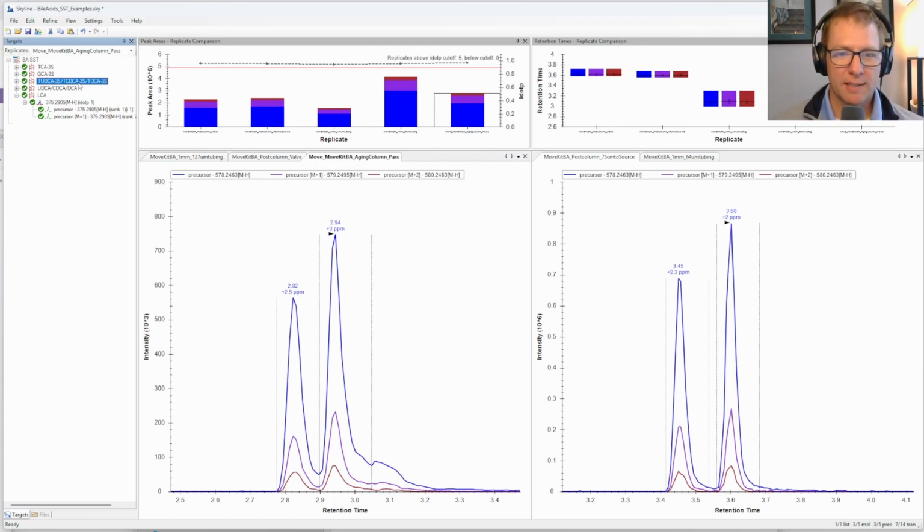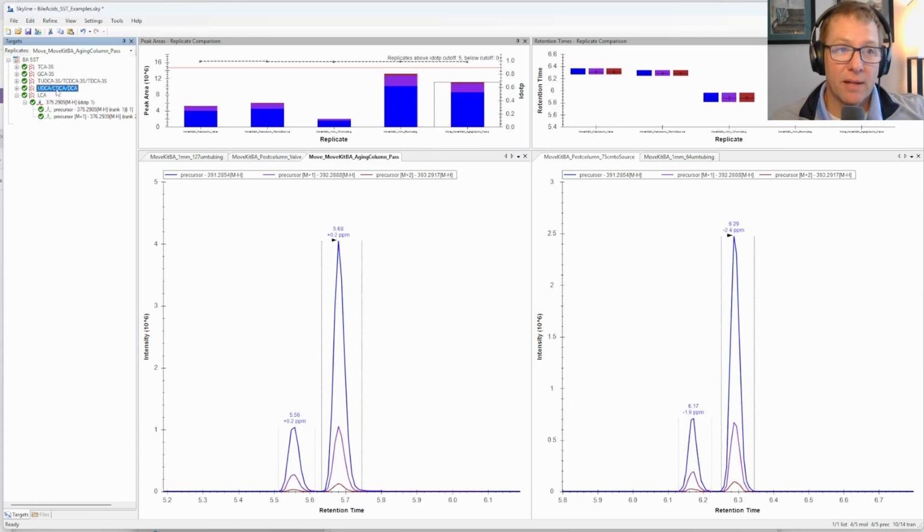When you see something like this on the left, you may be tempted to say, oh, I've got post-column broadening somewhere. The way that you know that it's not post-column broadening and it's something else going on is the fact that the fidelity of later metabolites or other molecules in the separation are good. That's sort of the telltale sign. If you have post-column broadening, nearly every peak will be affected in essentially the same way. That broadening mechanism is typically irrespective of molecule class.